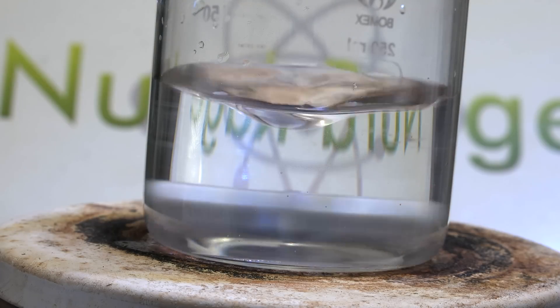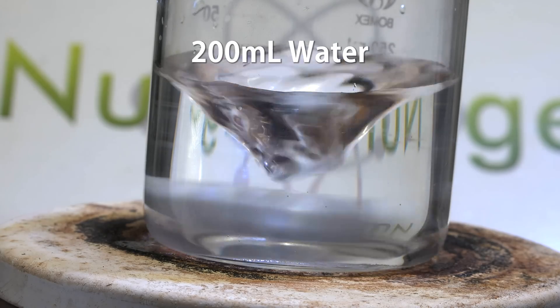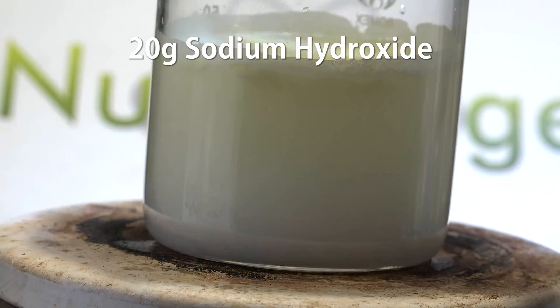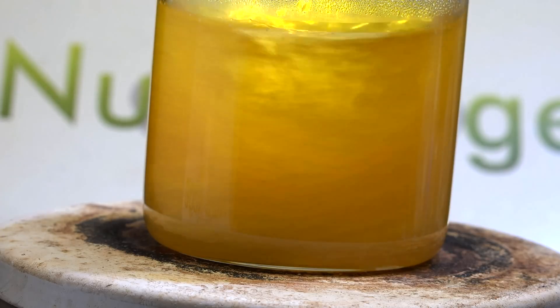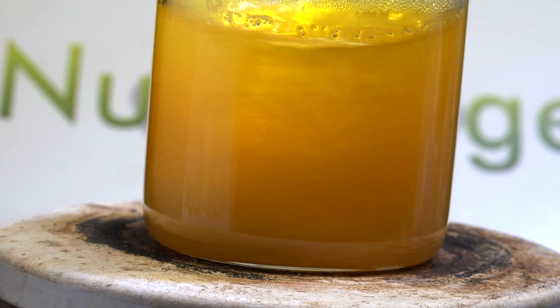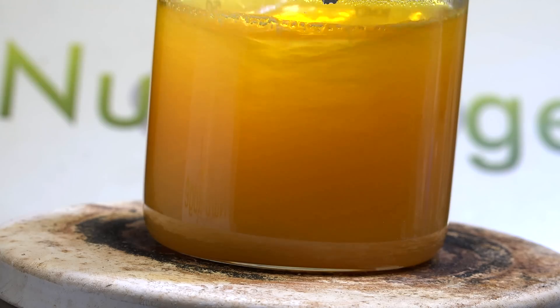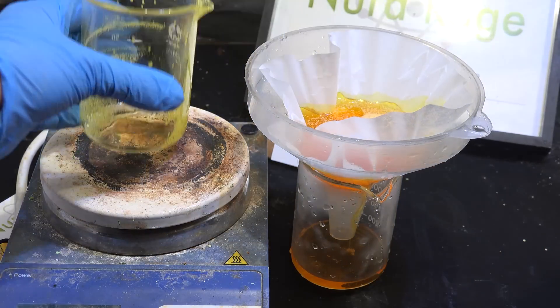First we need to make our anodizing solution. Start with 200 mL of water and stir in 10 g of powdered sulfur, then add in 20 g of sodium hydroxide. You may have to increase stirring to get the sulfur to mix. What we're doing is making a mixture of sodium polysulfides. Keep stirring for about half an hour or so, then filter the mixture to remove any excess sulfur.